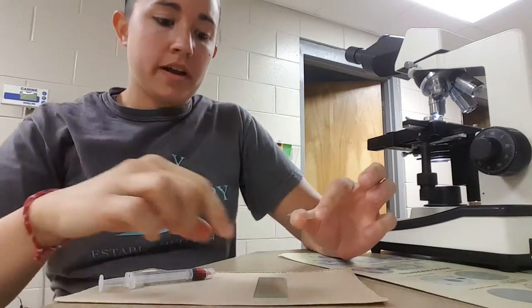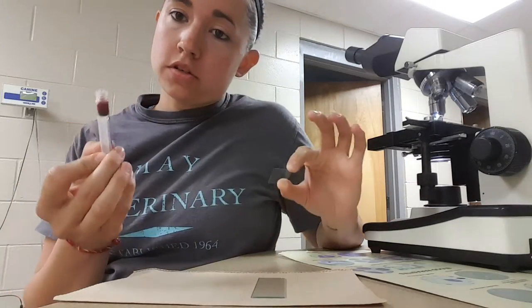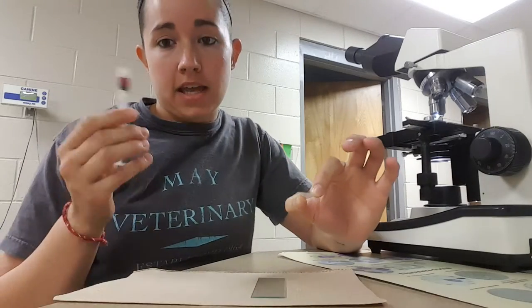Hi, my name is Brooke Armistead and I'm going to be performing the task direct smear to check for microfilaria. I have my tools here: a clean slide, a clean cover slip, and a syringe with freshly drawn blood that does have an anticoagulant added.